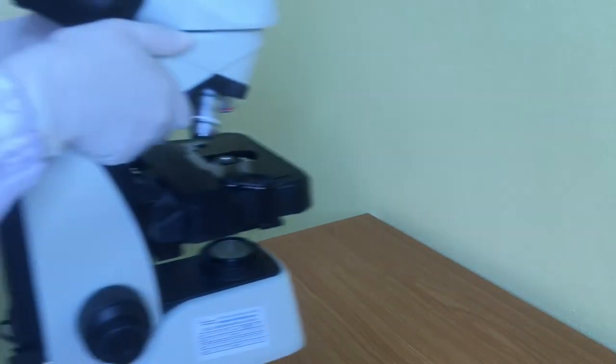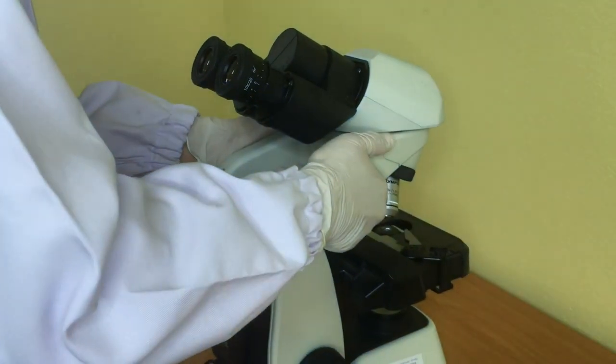Lift and move the microscope with both hands. Hold the arm with one hand and place the other hand under the base for support.